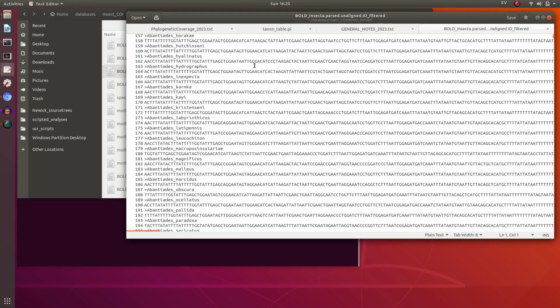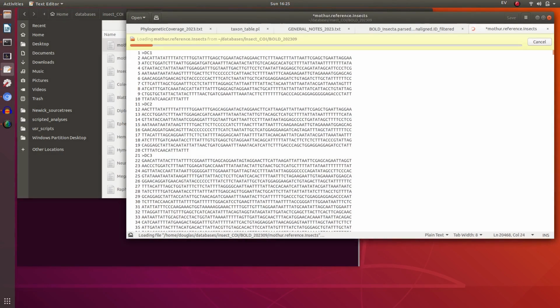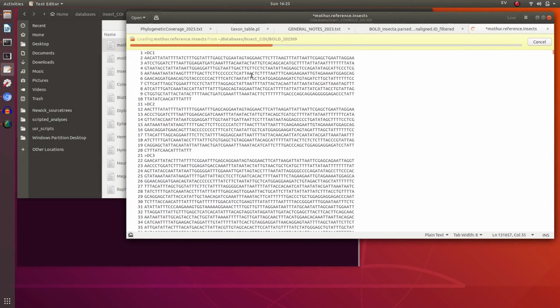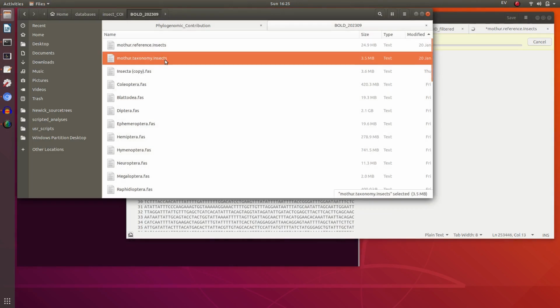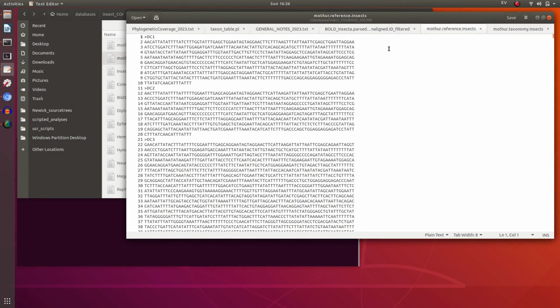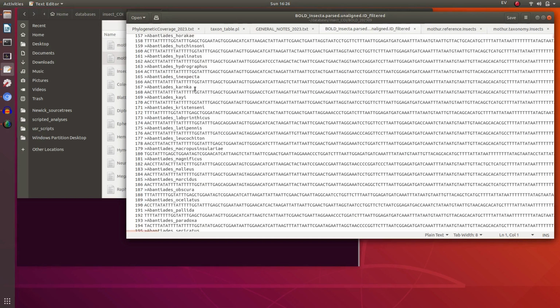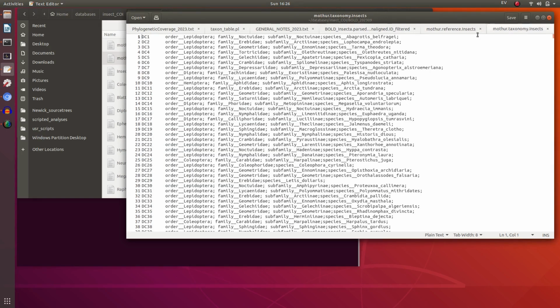So if we do that, we treat this as a query and we need some references. I'm doing this with the software Mothur. This is what the input for Mothur looks like. It doesn't need to be aligned. Just need some sequence in there. Need some code, and I need two files for Mothur: the sequences and the taxonomic names. So you can see we just have some codes where you normally have the ID, then this format which gives the taxonomic information. So if we identify this against this database using Mothur, then we can find probable mislabeled stuff.